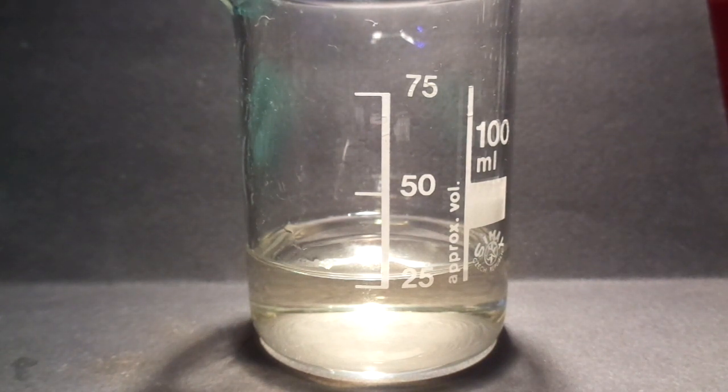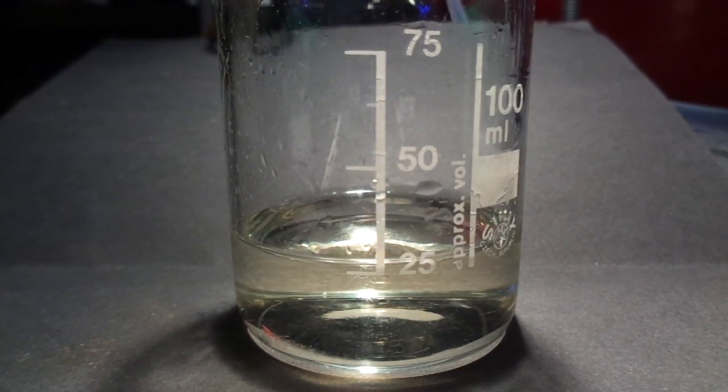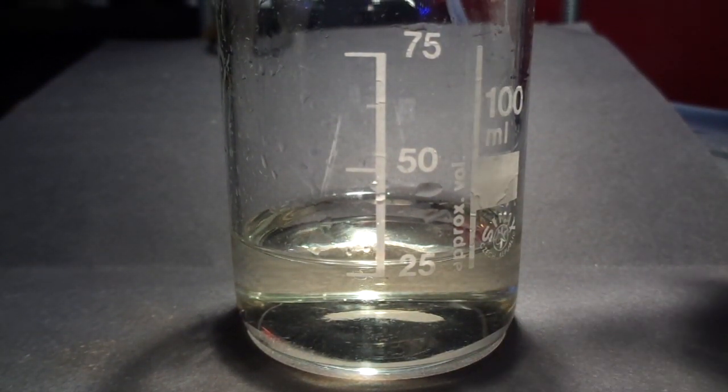So I'm going to prepare the solution of sodium carbonate or bicarbonate. It doesn't really matter how much you add. So let's neutralize and salt out our product.